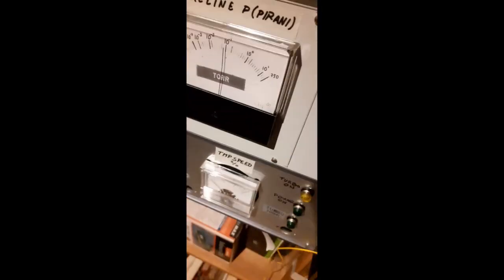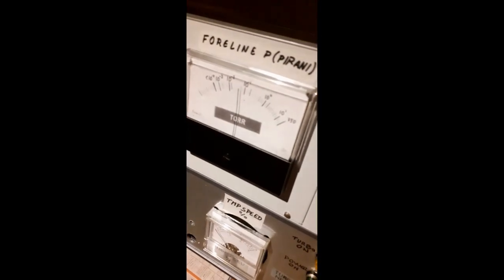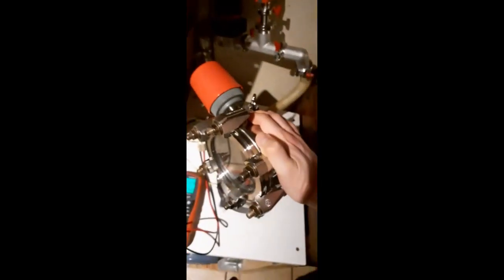Let's turn on the roughing pump first. And the noise is going to be a little appalling. Okay, now let's open this valve here. And as you can see, the foreline pressure dropped a bit. But now that's open, there's a continuous vacuum being drawn on this.